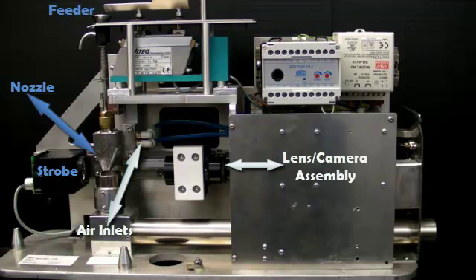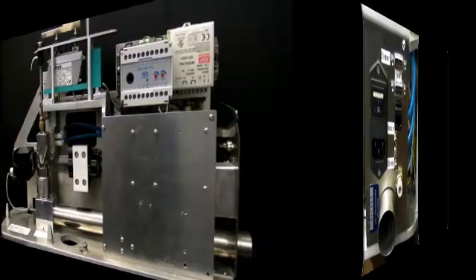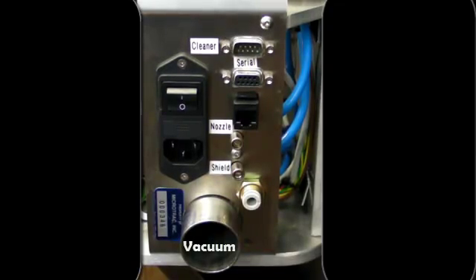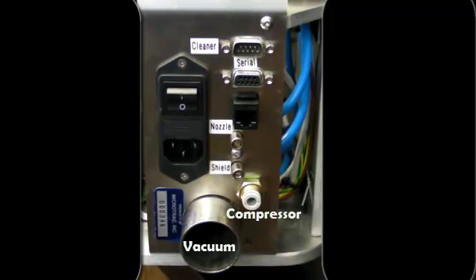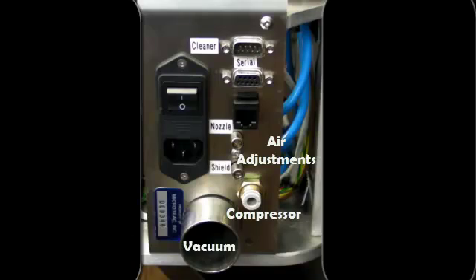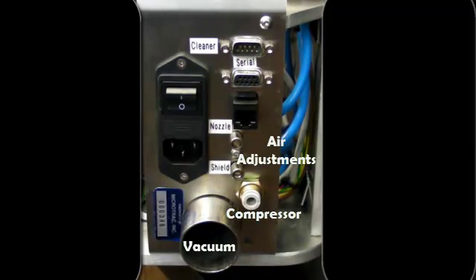At the top again is the feeder, and at the lower right is the connection for applying vacuum if desired. This is a view of the DIAF back panel where we see the vacuum connection, and just above and to the right of that the compressor inlet if dispersion air pressure is desired. Just above are adjustments for the nozzle air, which disperses the particles, and for the shield air, which travels downward on each side of the sample stream to keep the particles on the focal plane.